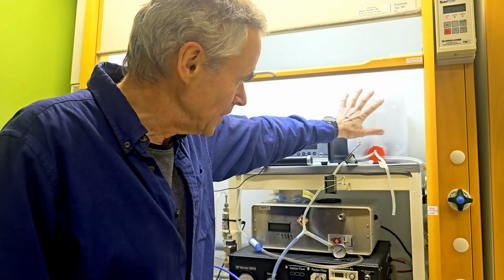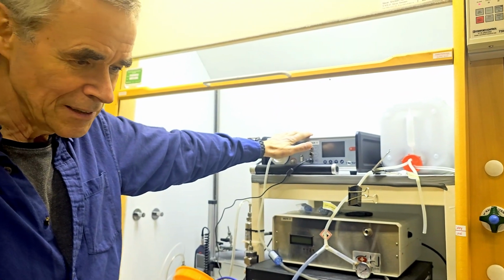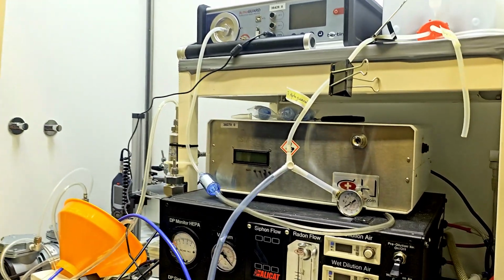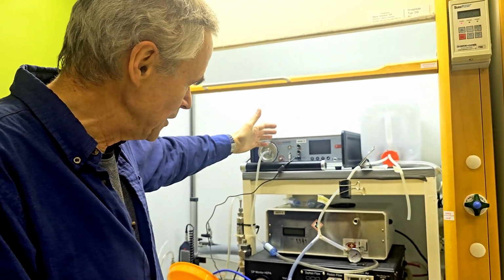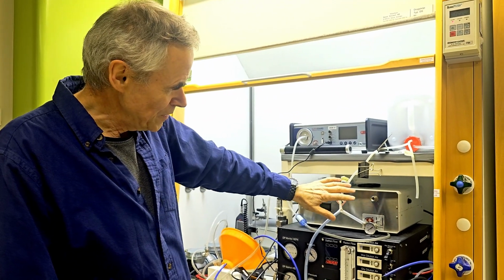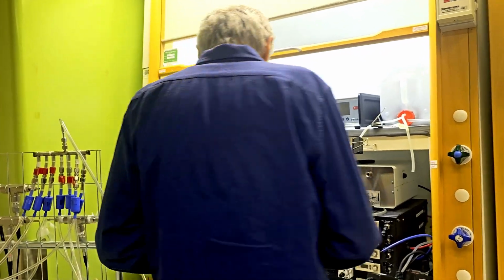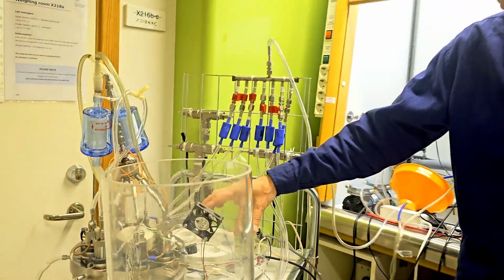So we have the radon source, we have our alpha guard, the dosimeter to measure radioactivity, and we have a cigarette smoking machine. So when we run experiments, we suck radon out from the source, it goes to the alpha guard, and the activity is measured. At the same time, we let the machine smoke cigarettes, and the radon and cigarette smoke are mixed in this mixing chamber, and then the gas is flowing into this cell exposure chamber.